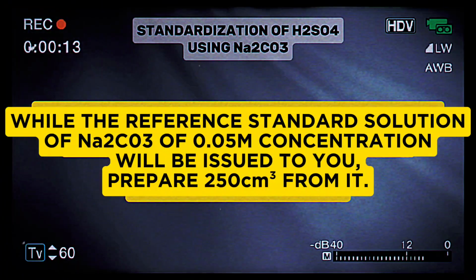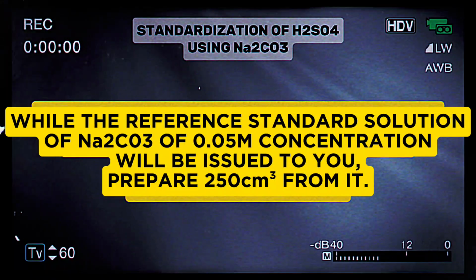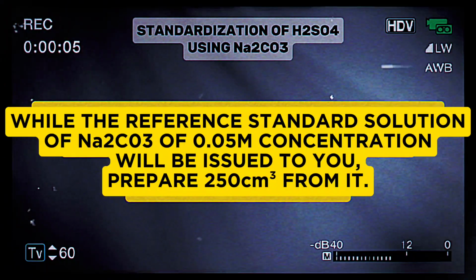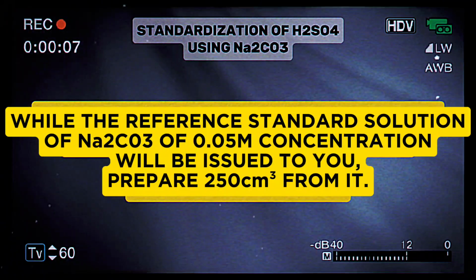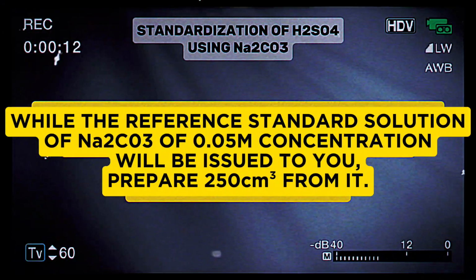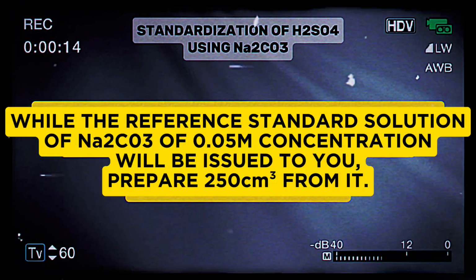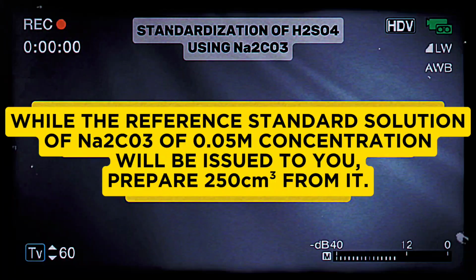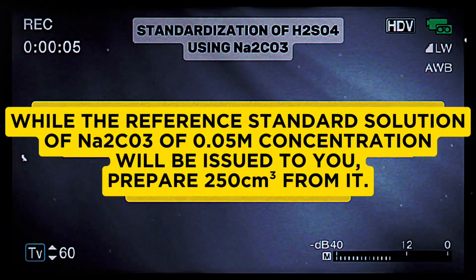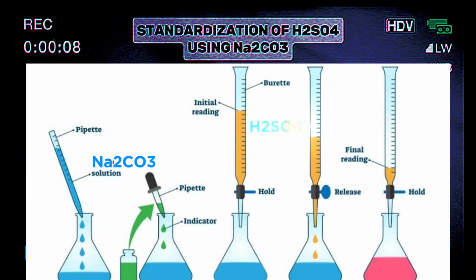Having known that we have our primary standard to be sodium trioxocarbonate(IV), whose concentration is known and given to be 0.05 molar, you have to note that that is the concentration of the sodium trioxocarbonate(IV) serving as our base. You're expected to prepare the solution in 250 cm cube, all right?